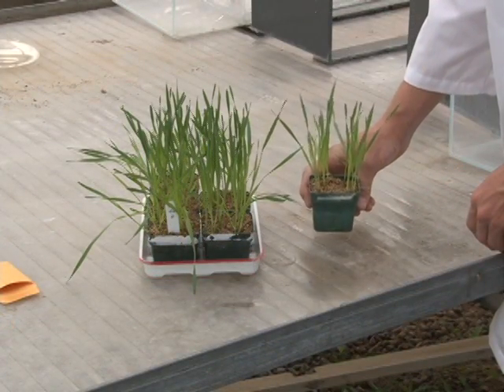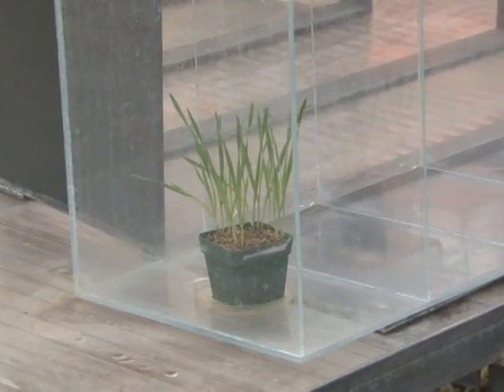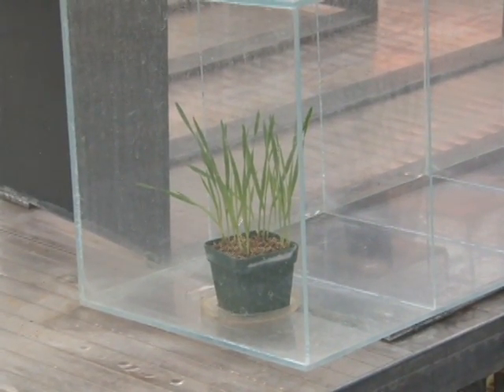The sixth pot is placed into an isolation cubicle. After the rust has increased on this susceptible line, we can collect the rust for further analysis at a later time.